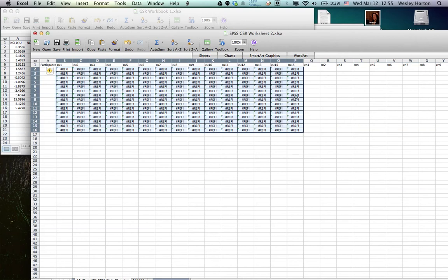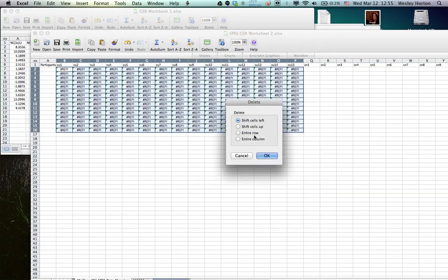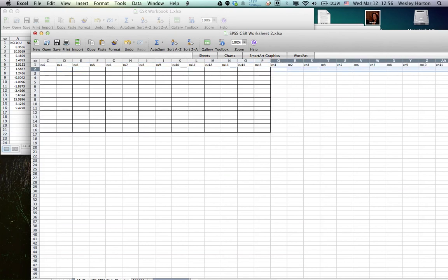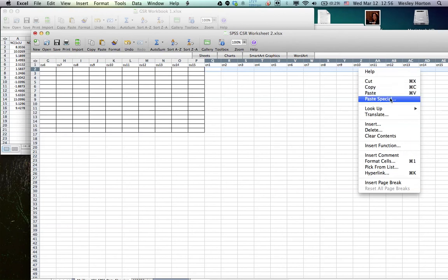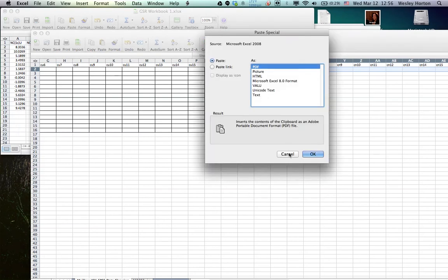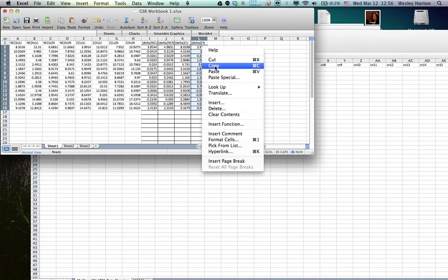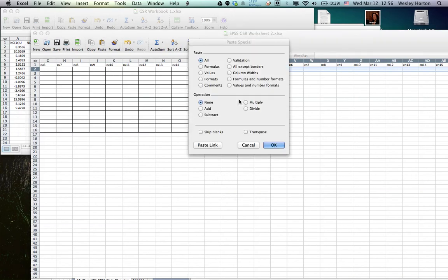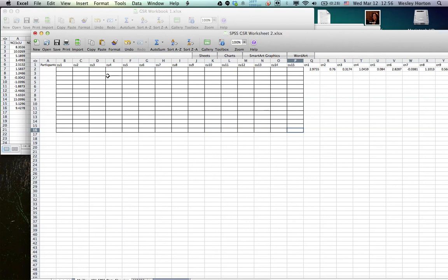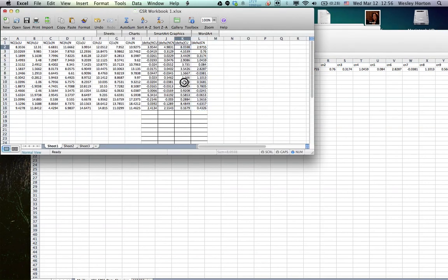Whoops. I always forget to do that. Okay. Delete. Do clear contents. All right. Oops. This is SIBS neutral. Paste special. What happened? Okay, let me grab it again. Copy. There we go. Values, transpose, okay. I don't know what happened here, but I'm just going to put it in. Just made a mistake. So this is SIBS unpleasant.